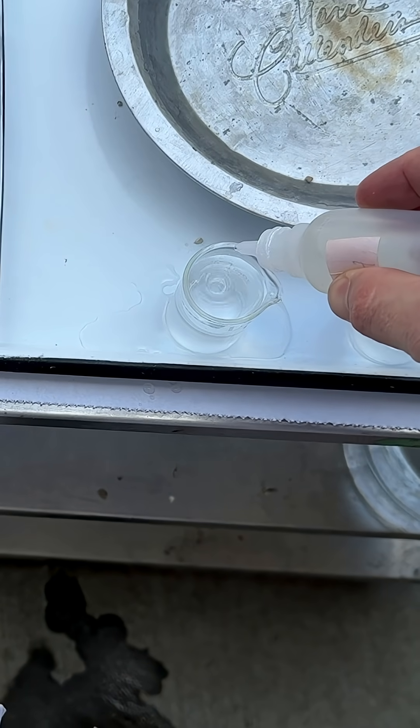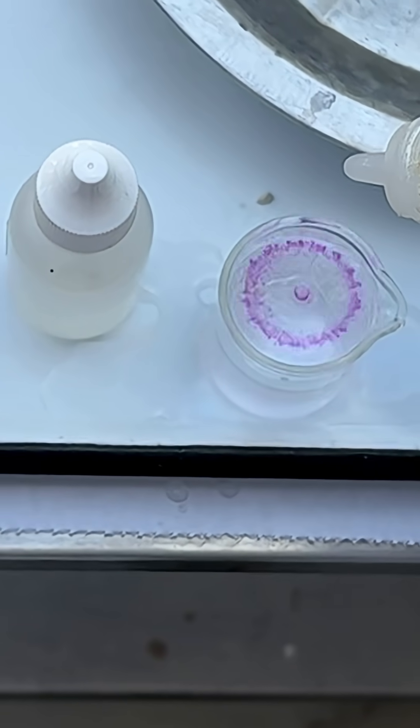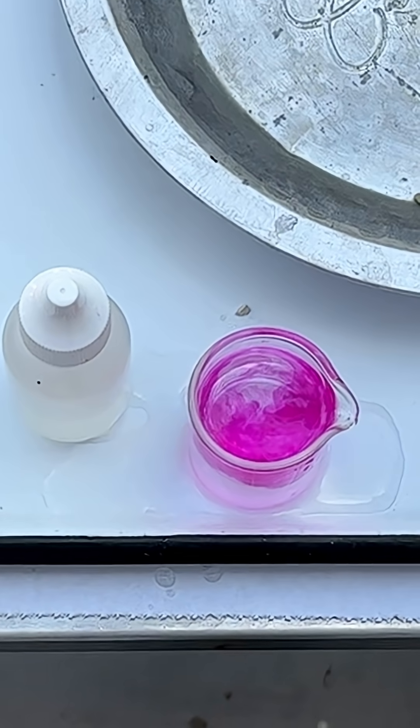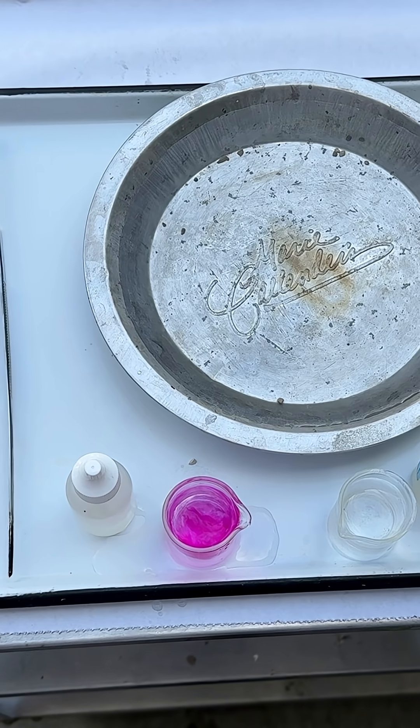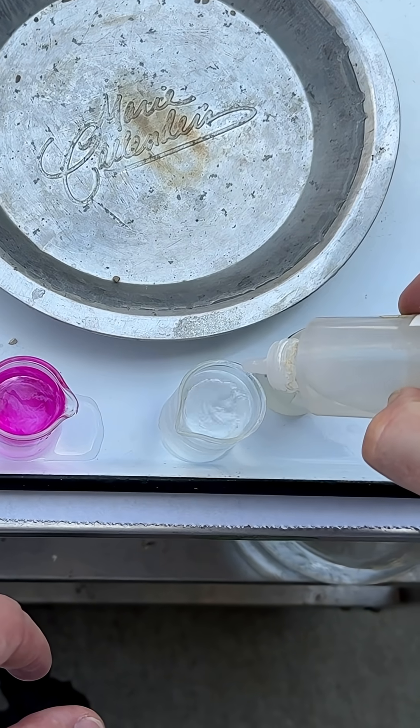This one's a base, and this indicator is called phenolphthalein. See if you can tell me what phenolphthalein does. It's a great color — immediately turns it pink. Now let's put it in the acid and see what color it does. Absolutely clear.